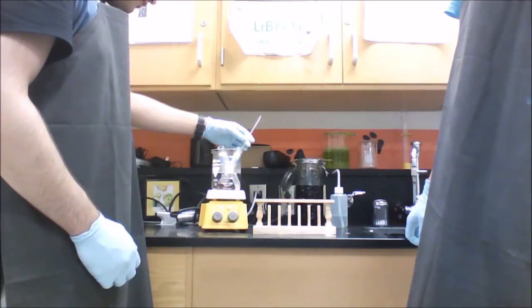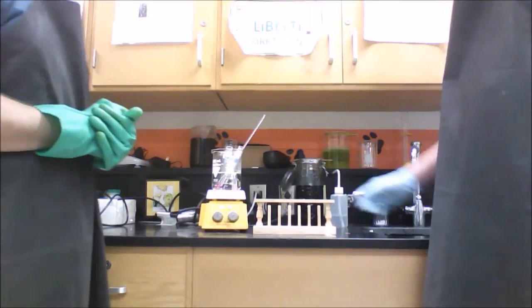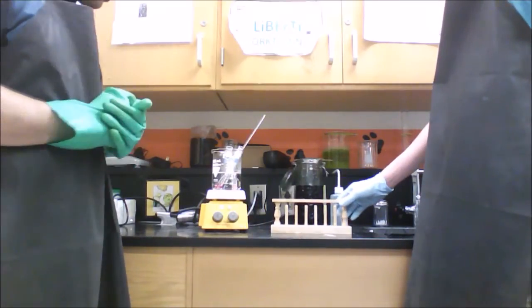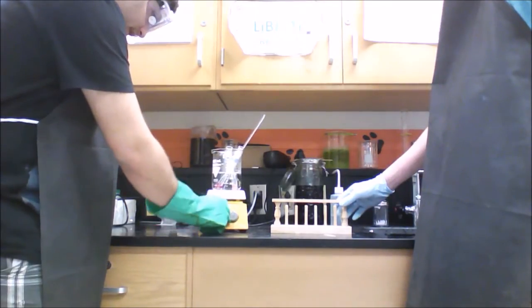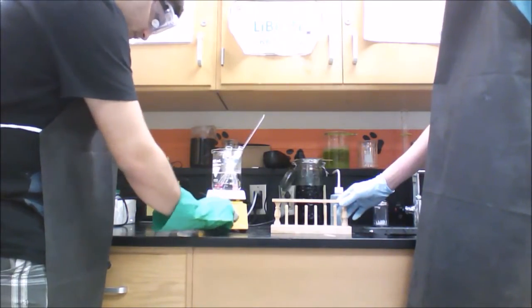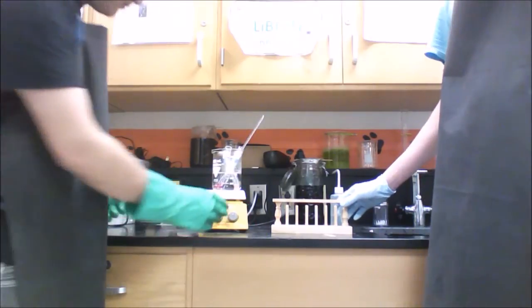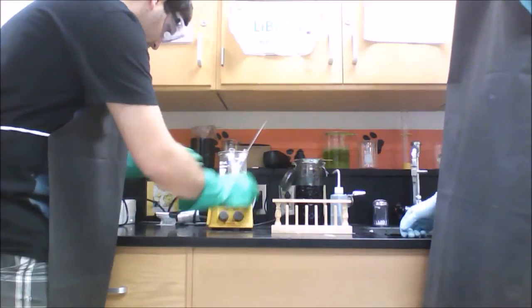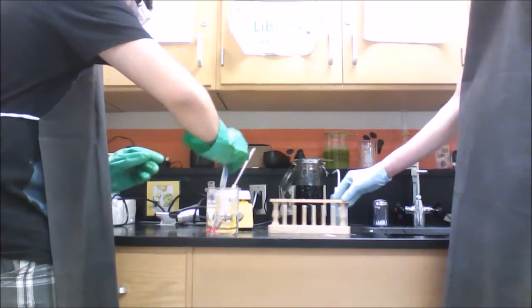Make sure your thermometer is showing, and we're going to start it at 5 minutes and see what the results are. Now, after 5 minutes, we're going to pull out our test tubes and check how the heat has affected these chemicals. So first of all, obviously turn your dial all the way down to turn the heat off. For safety, make sure the light turns off if there's a light on your hot plate. And carefully take this beaker off and pull out each test tube and observe.